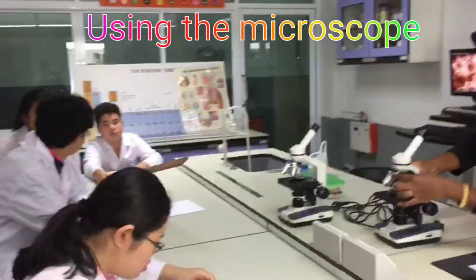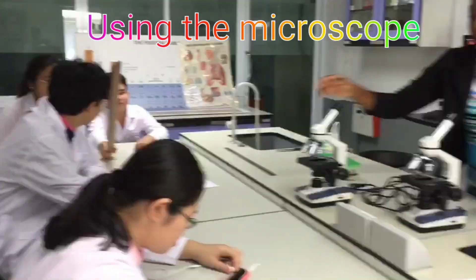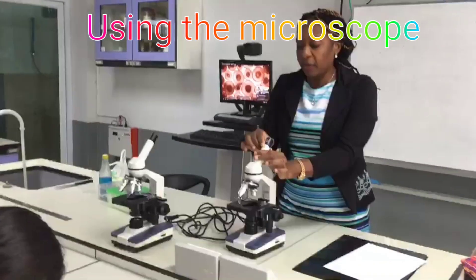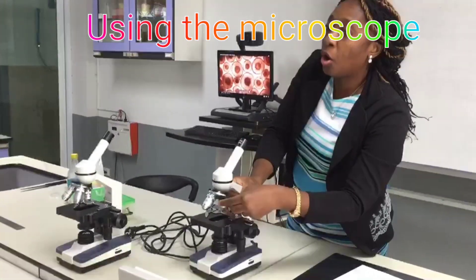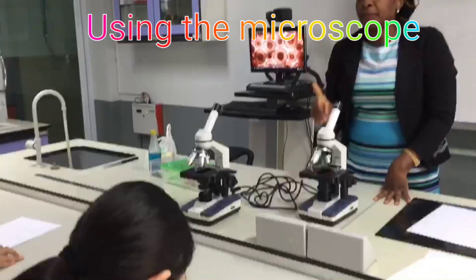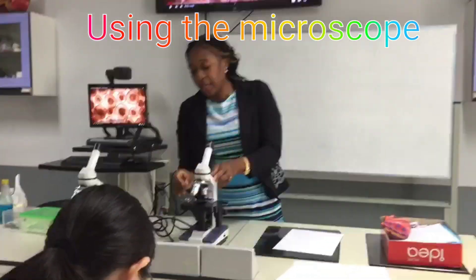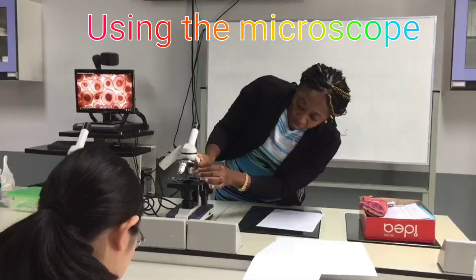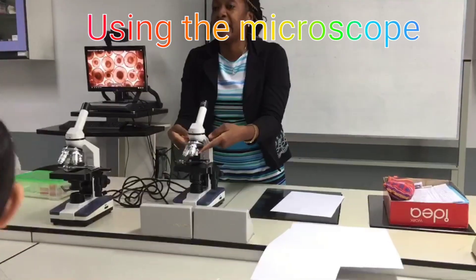Some microscopes have even 100. This has 4 magnifications, and the lens here has 10 times magnification. So you multiply this 10 by the 4, 10, or 40 that you will use. But you should always start your observation using the low power magnification, which is the red. Before you start observing, it should always be on the red.